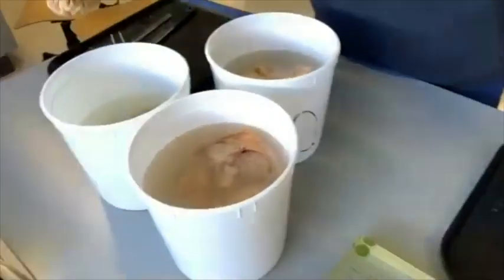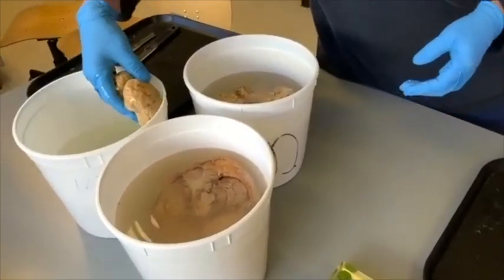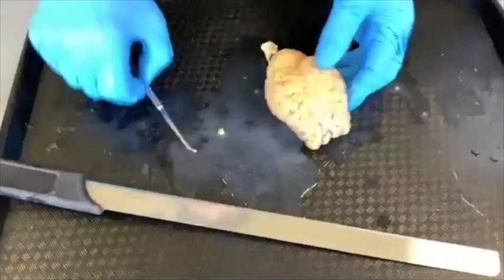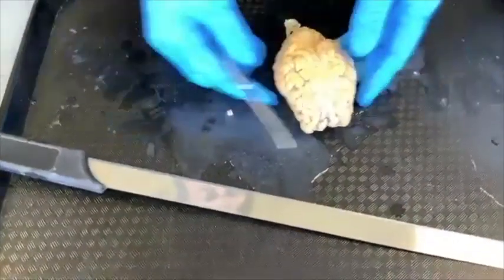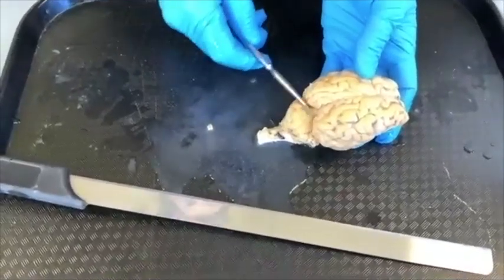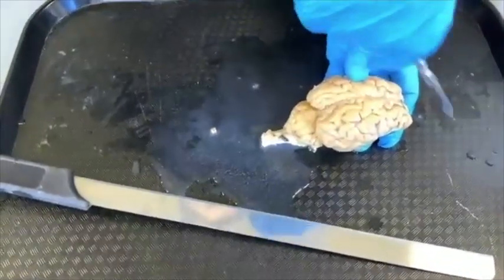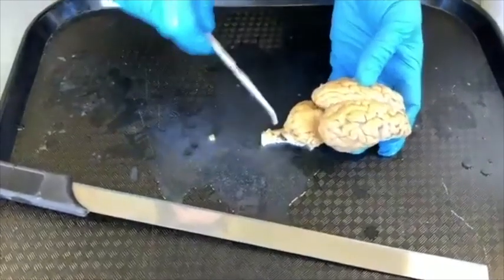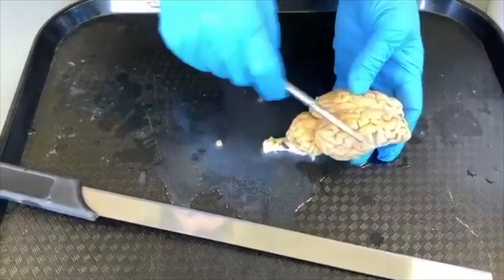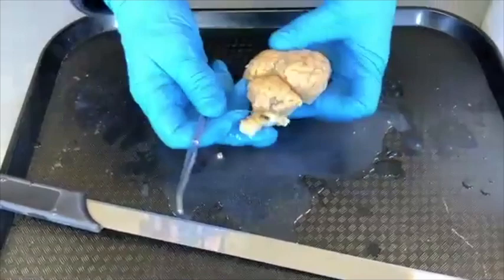Now we're going to find exactly the same structures in a sheep brain. Here's a sheep brain. What you can see is there's a comb-over, not quite as large because more of the cerebellum is visible. Here's the sheep's face, back here is the spinal cord. This is the cerebellum, and this is the cerebrum — this is telencephalon.